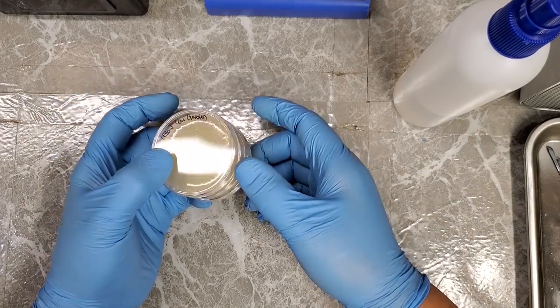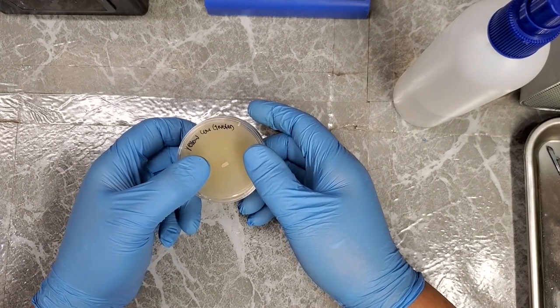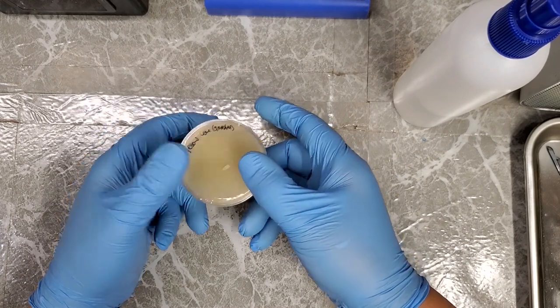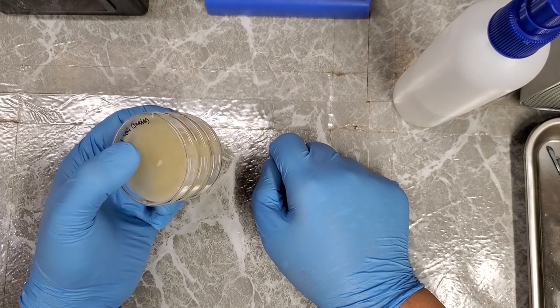So that's really all there is to it. I'm going to put these off to the side, and since I have everything set up out here, I have a few more that I'll get out of the way and just do that before I go inside. But yeah, that's how you salvage, or at least attempt to salvage, a contaminated mushroom culture.